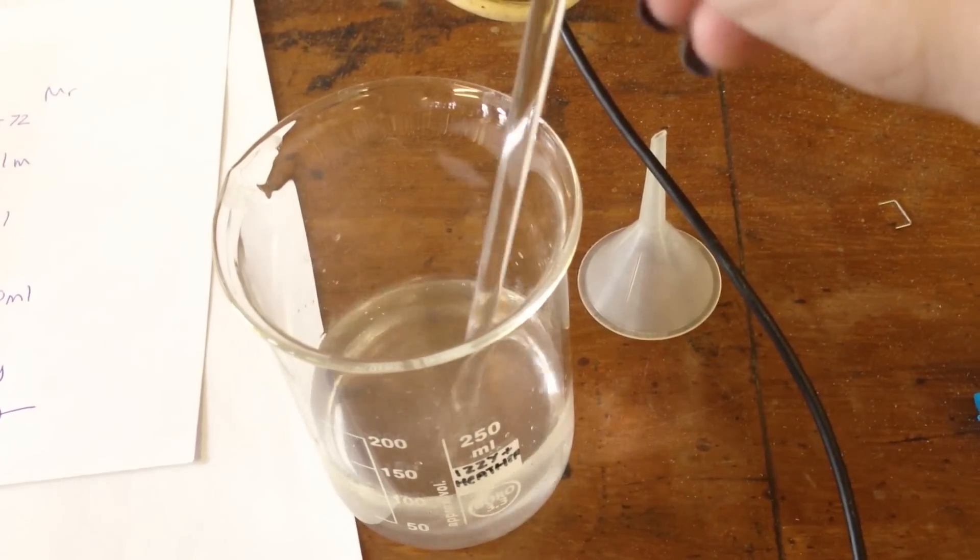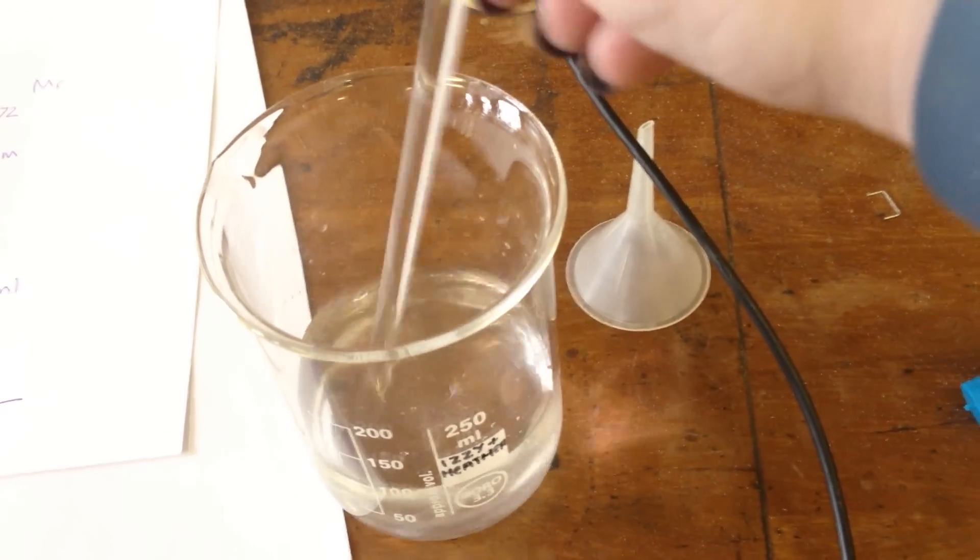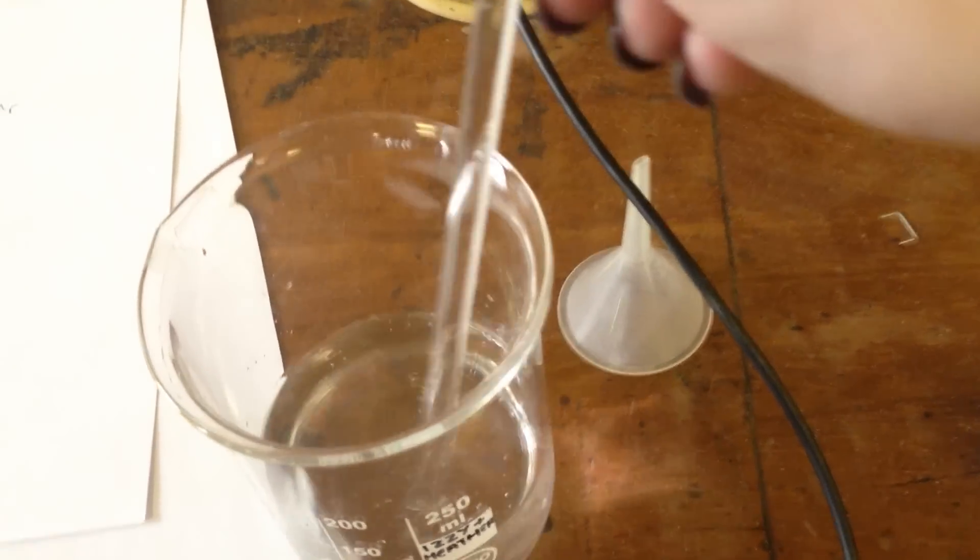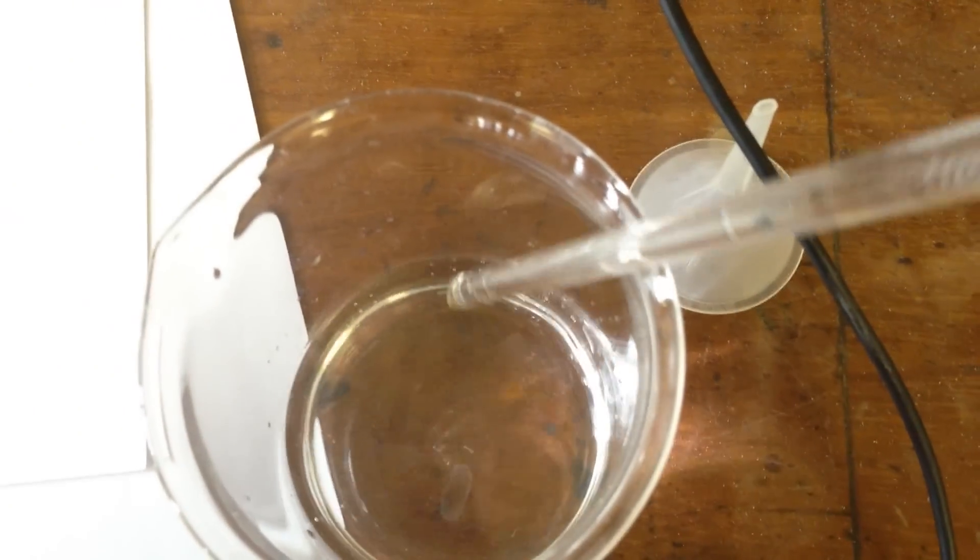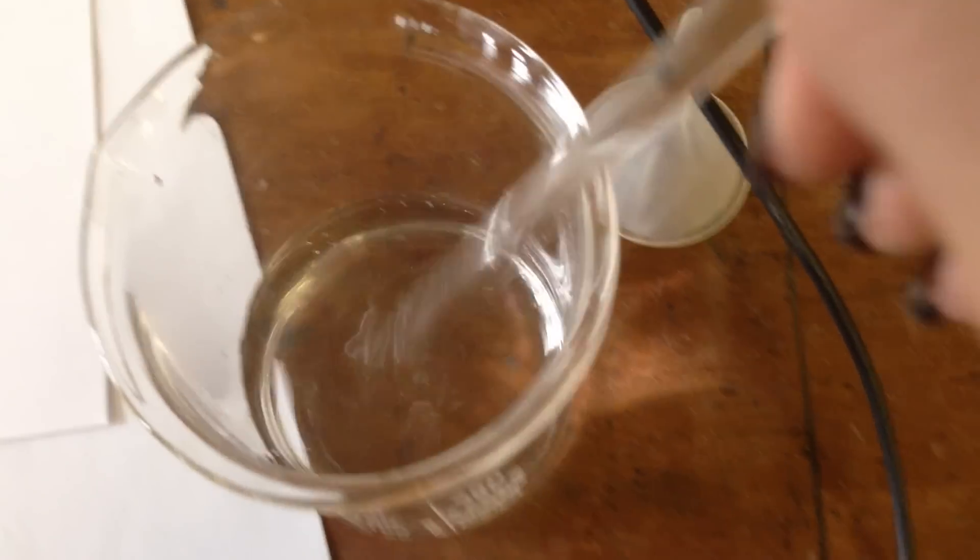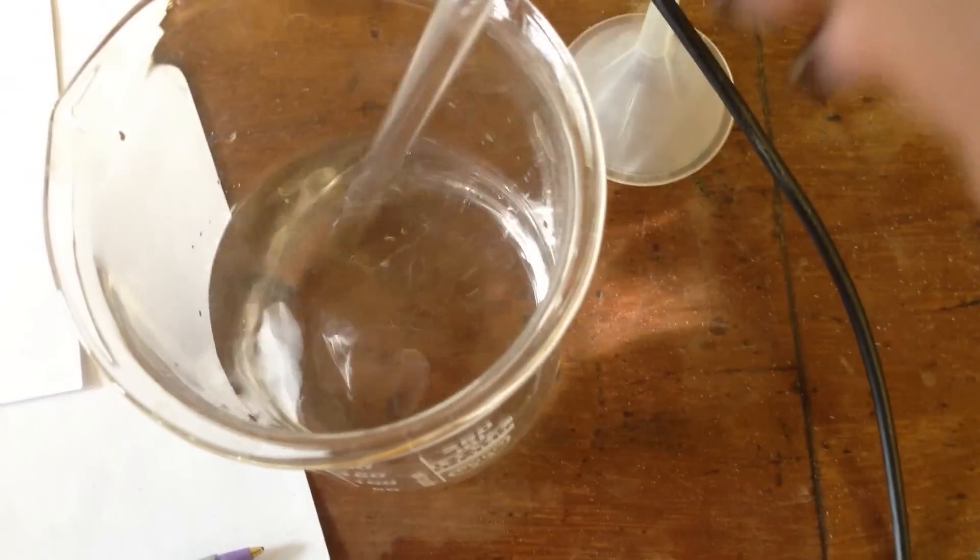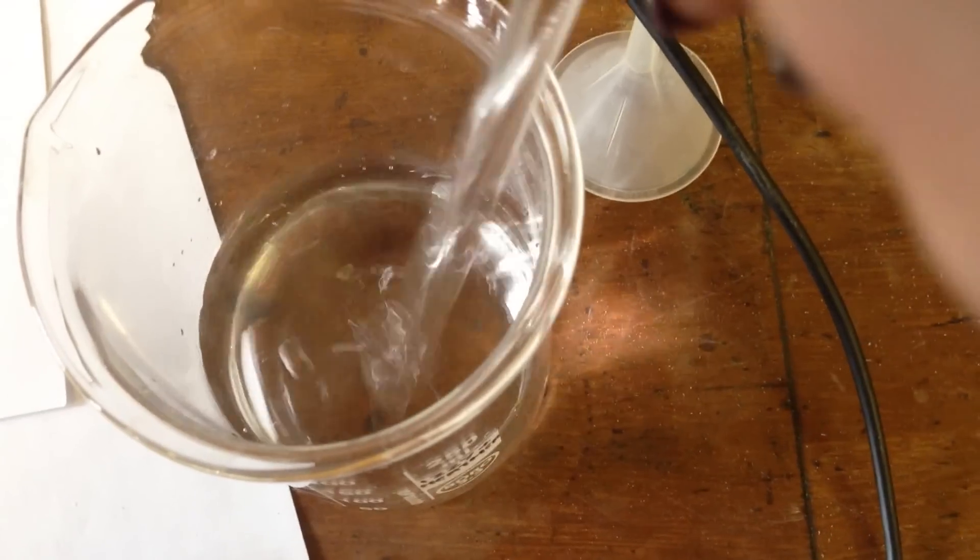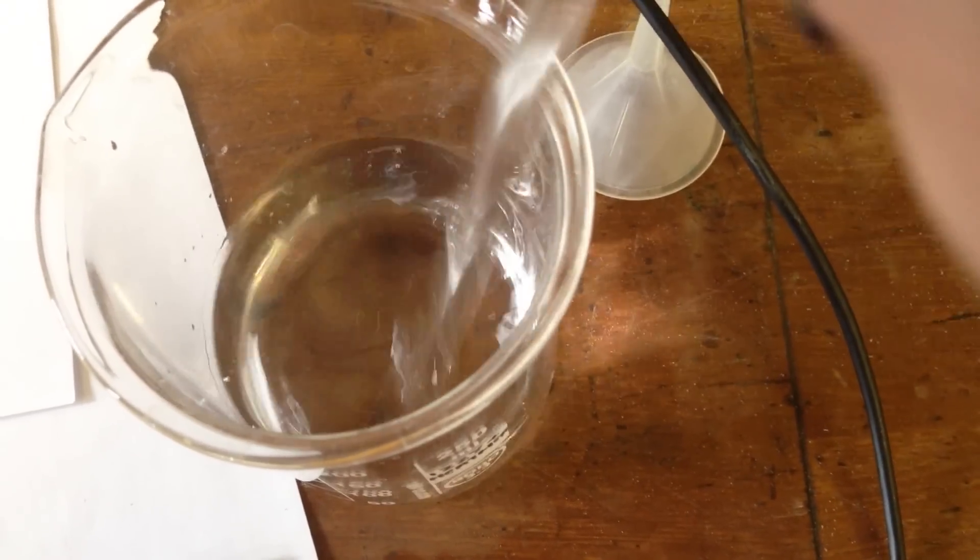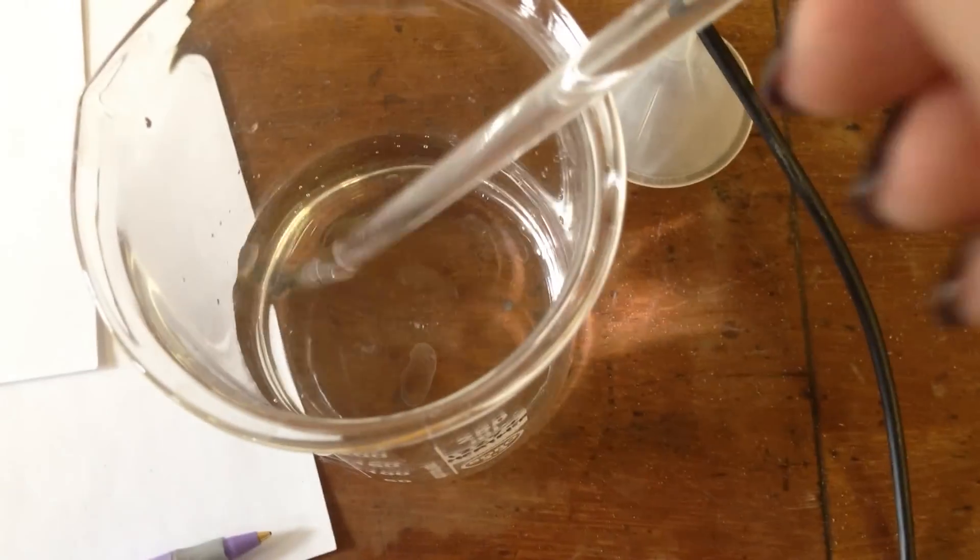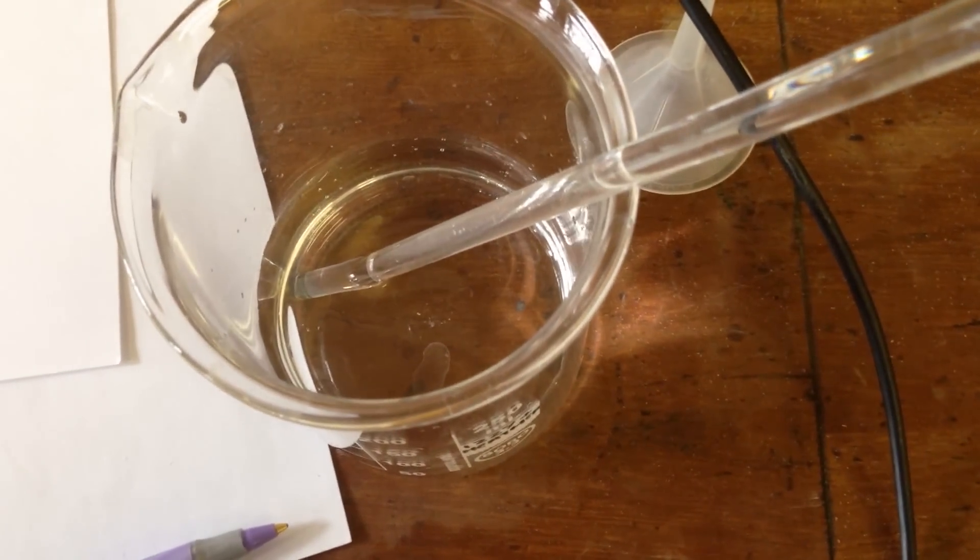This may take a while for some things or it might be quite quickly. Depending on what it is, things dissolve at different rates. If we look in here, we can see that there is still some bits at the bottom. So this needs to stir a bit more until it is all dissolved. Still a few bits in the bottom. I'll keep going with this and come back to you in a second.